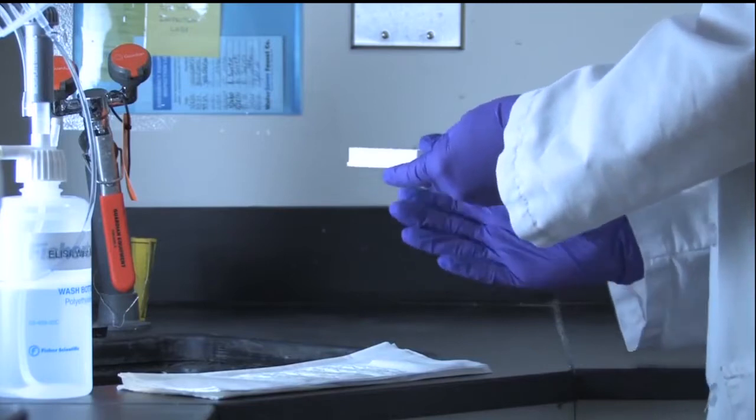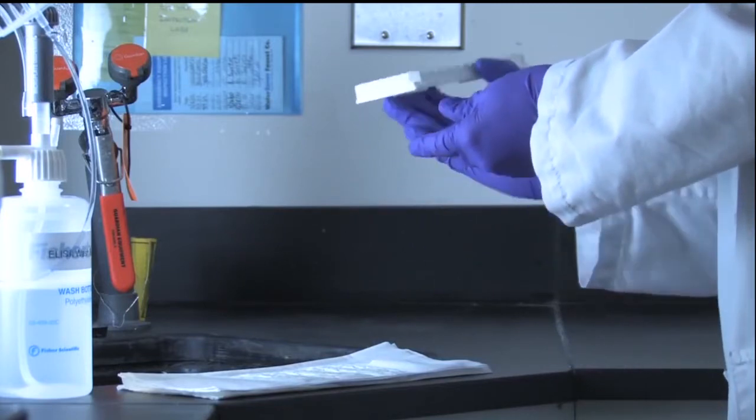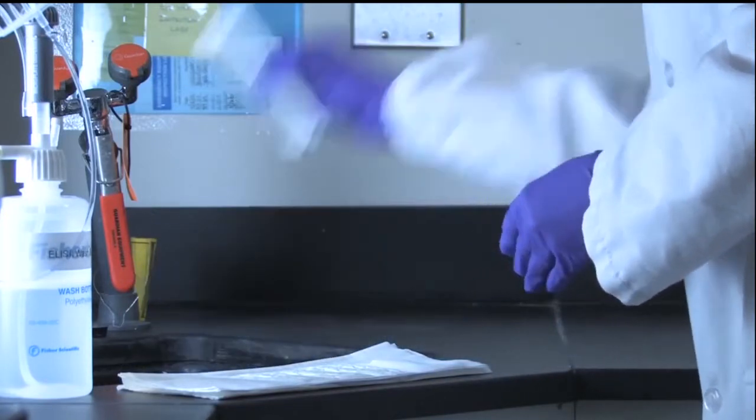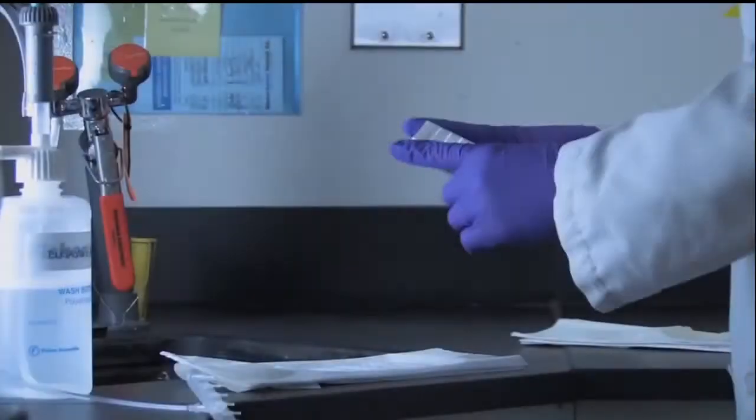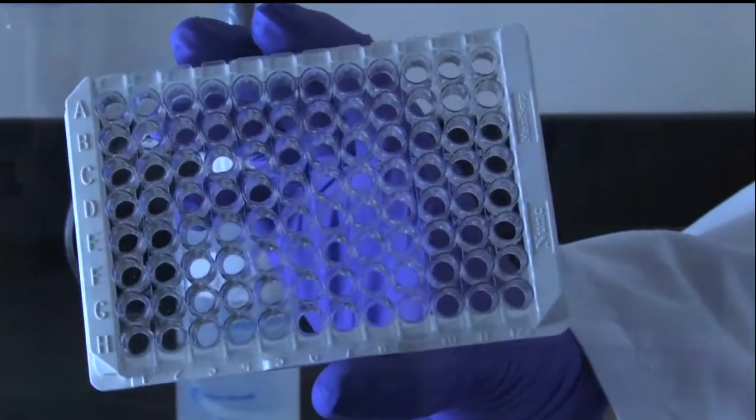Observe any soaking time indicated in your protocol, then discard. Repeat the washing, soaking, and discarding steps for the number of times indicated in the protocol.